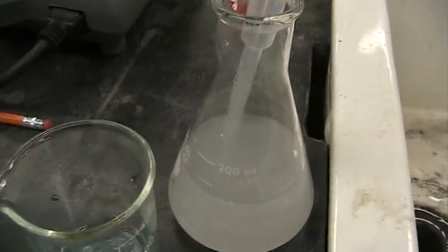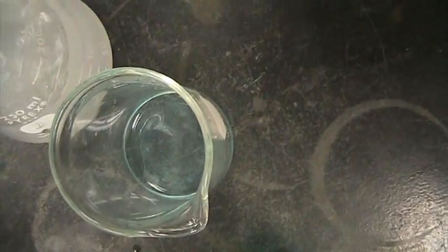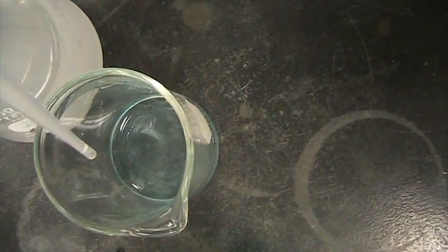Now, you have to look very carefully. We're going to add a few drops of barium chloride to the copper sulfate.